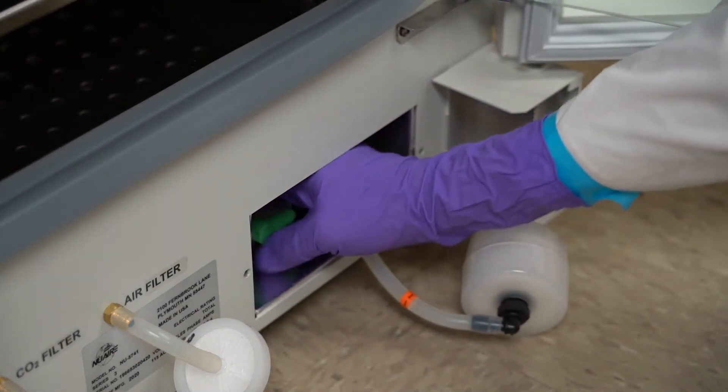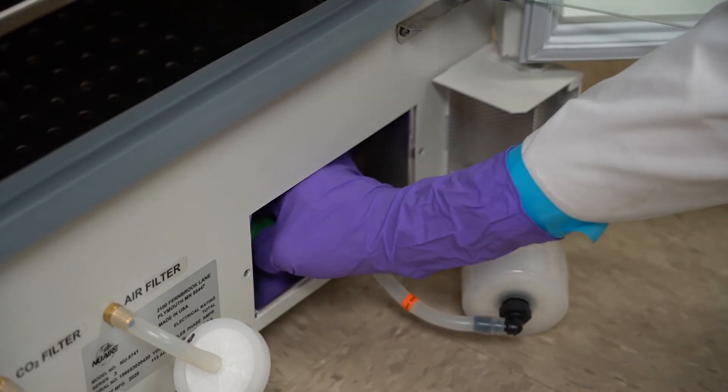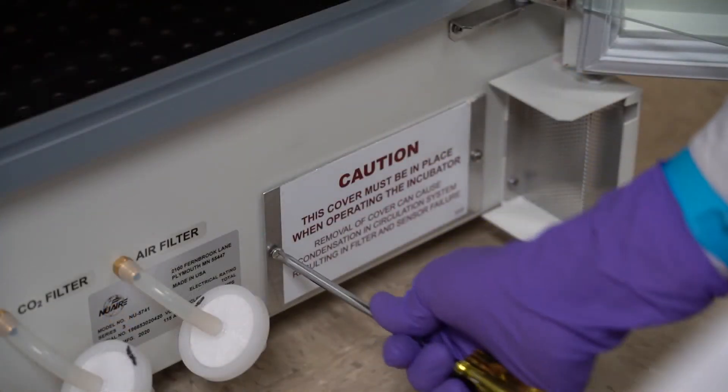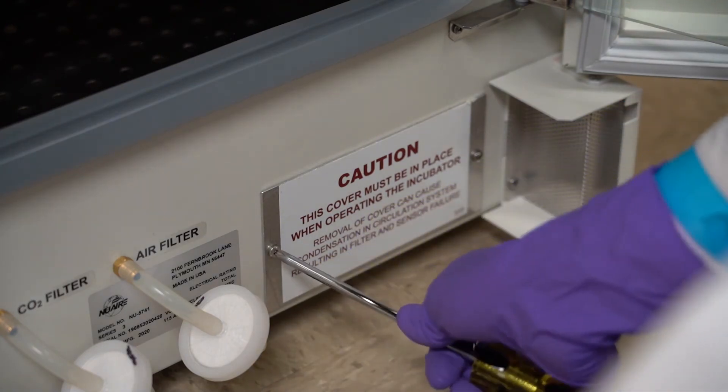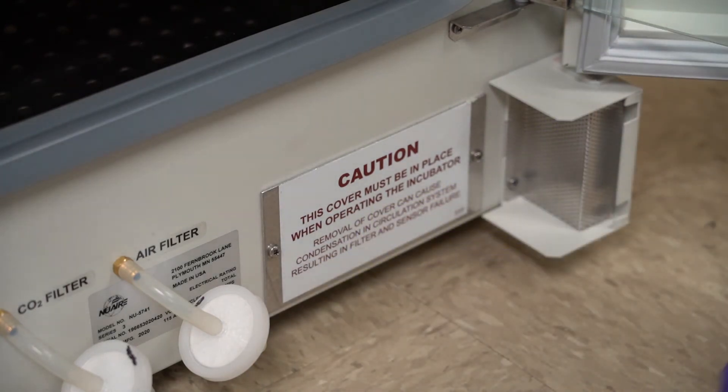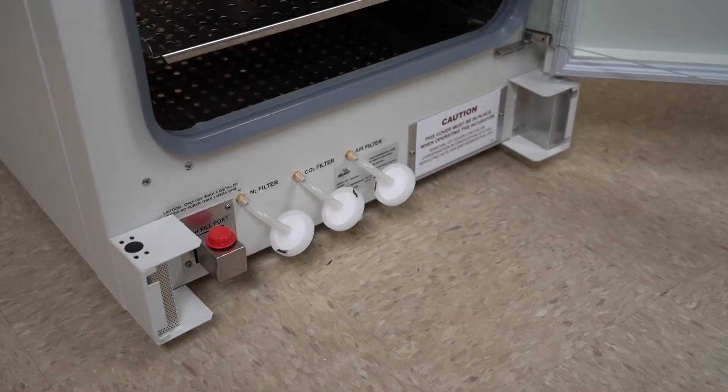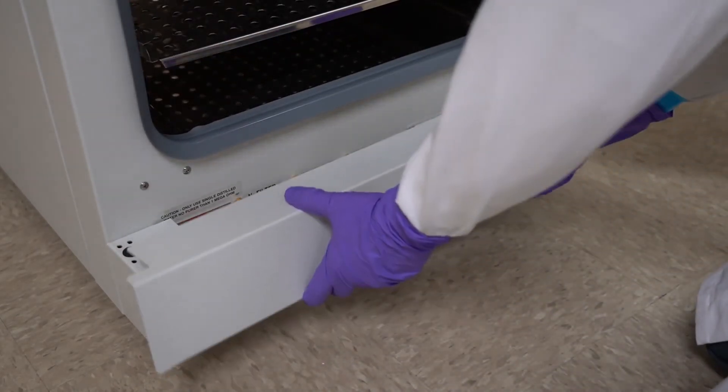Carefully place the new filters back into the sensor bay and replace the cover. Replace the valance and close the door when finished.